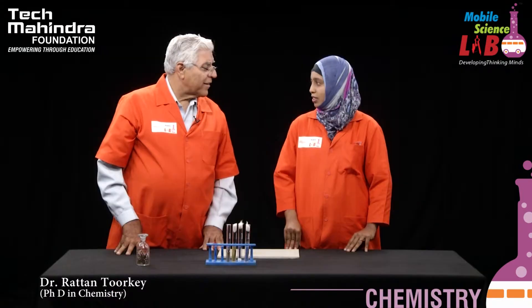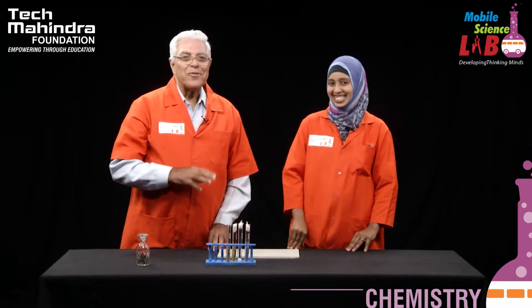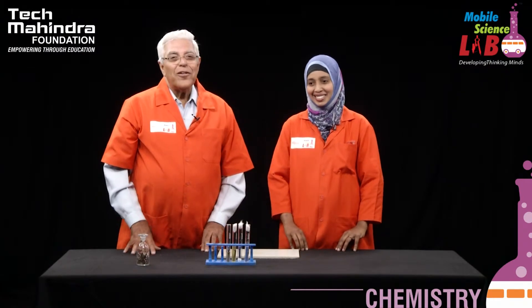So students, this experiment takes a little time — about a week is necessary. If you want to do this, you will have to observe the results one week later; you will not get results immediately. I hope you have understood what rusting is. We are all students till the last days of our life. I hope you have enjoyed this, and you can repeat this experiment at home quite easily.